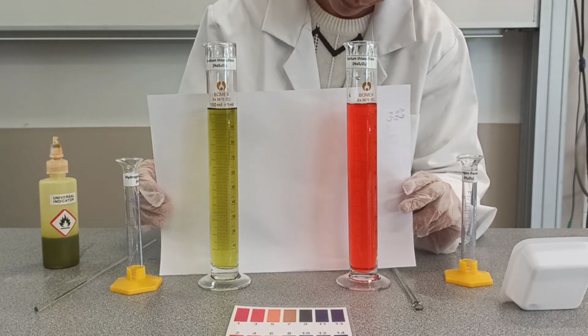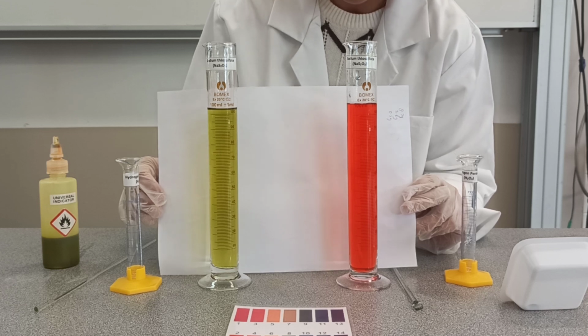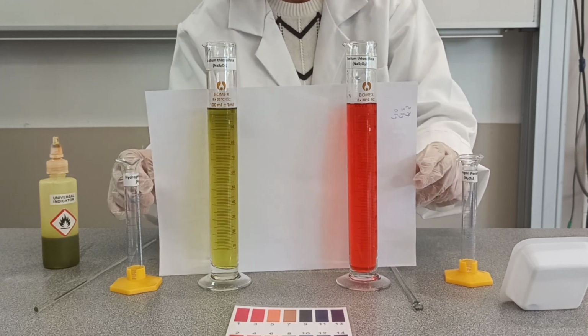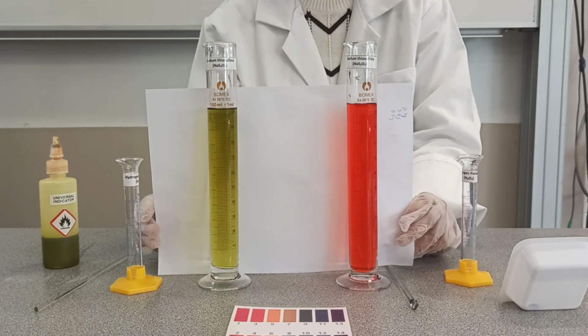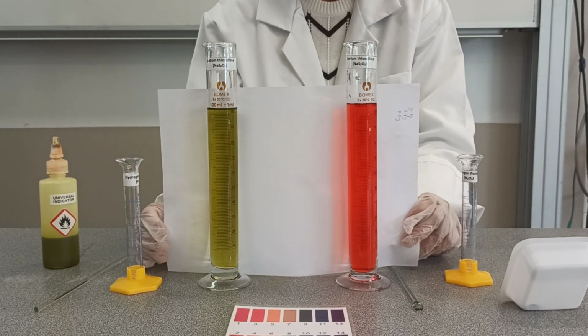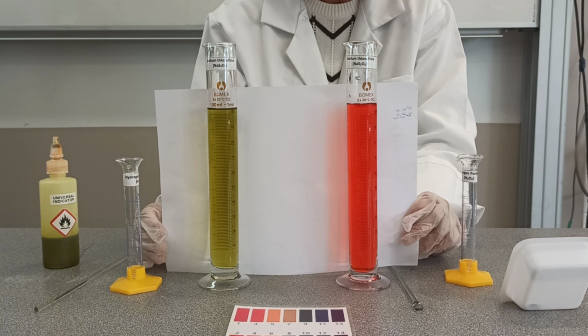We can see that the color has changed from deep blue to green. It is still going on. The timer is still going on. Now the questions to consider in this reaction are, why did we add hydrogen peroxide in the end? Or what was the catalyst used and how did it work?